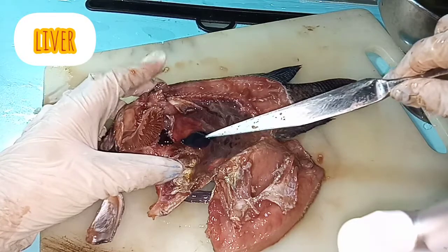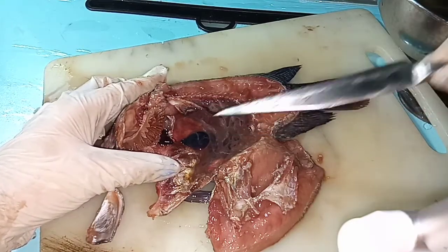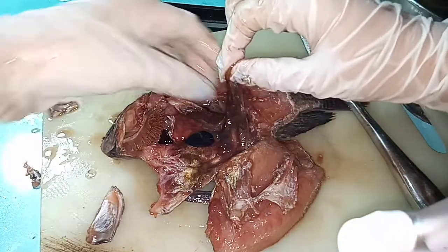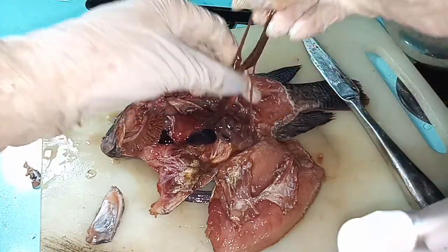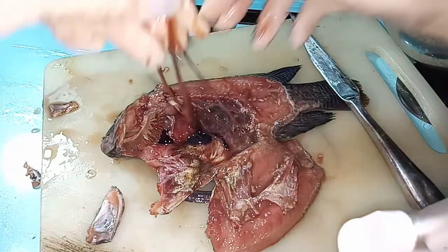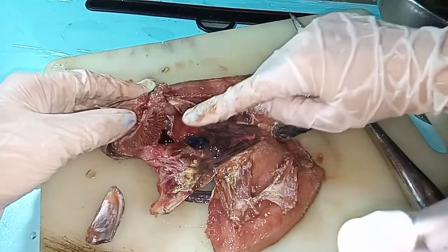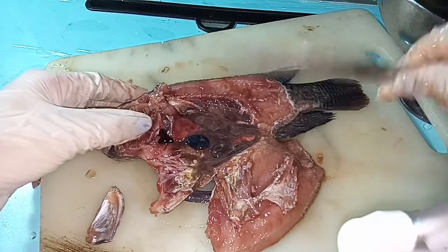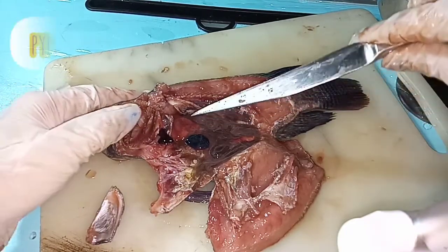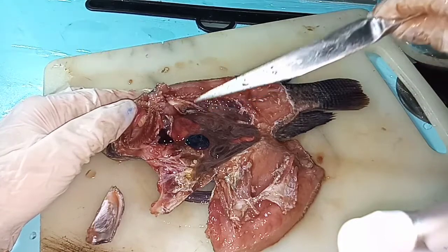This is the liver — the second part, which is the larger dark-colored organ. And over here, this long part — that is the intestine. Then this part is called the pyloric caeca.